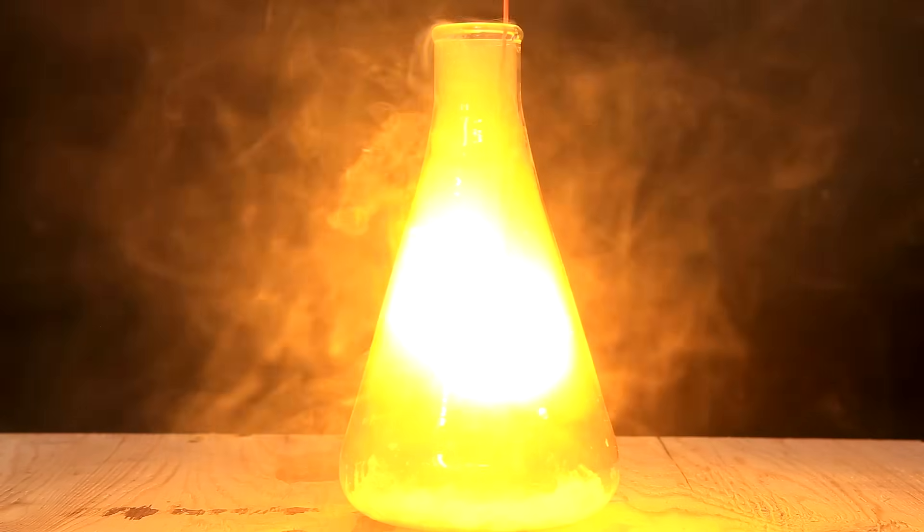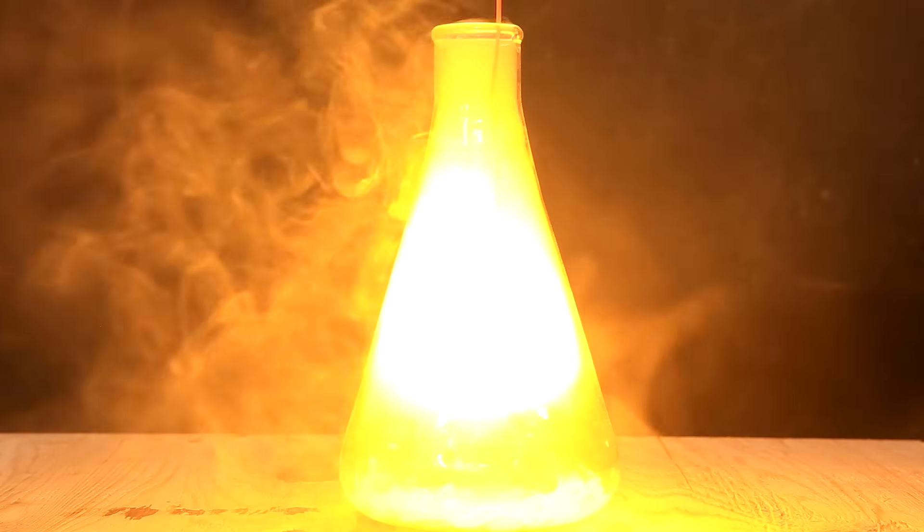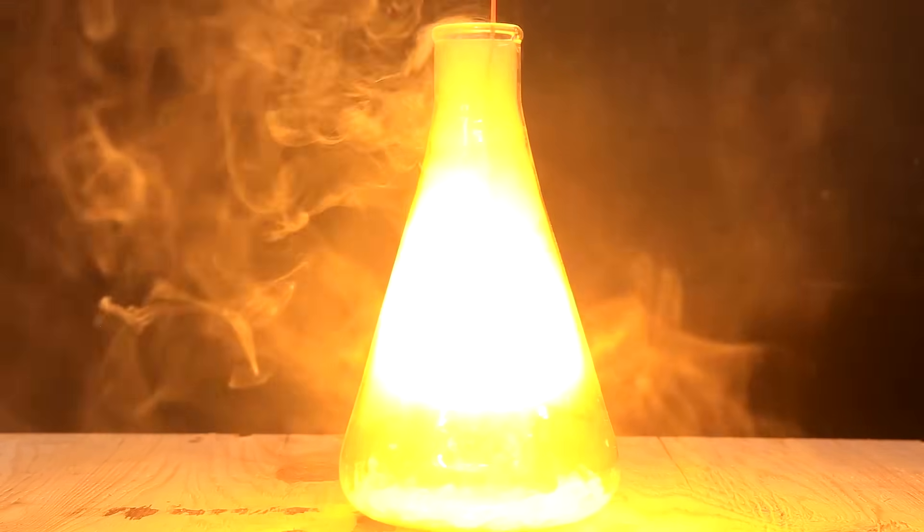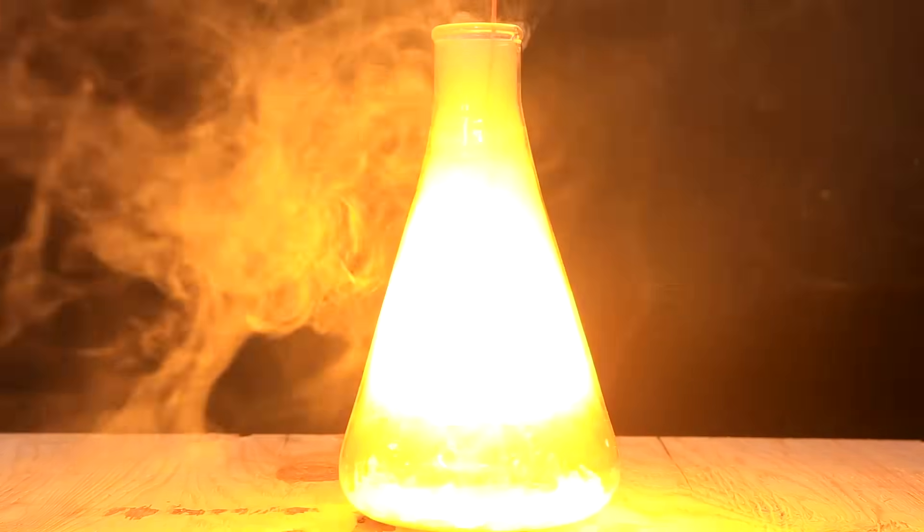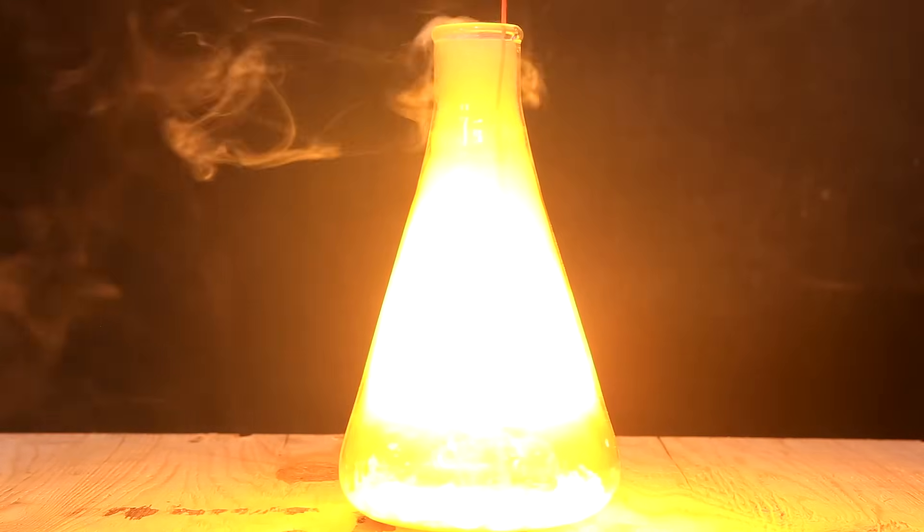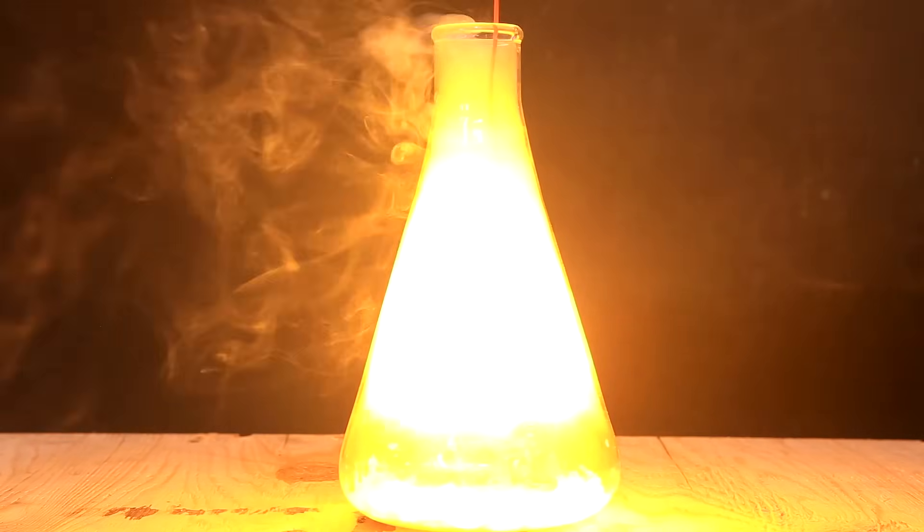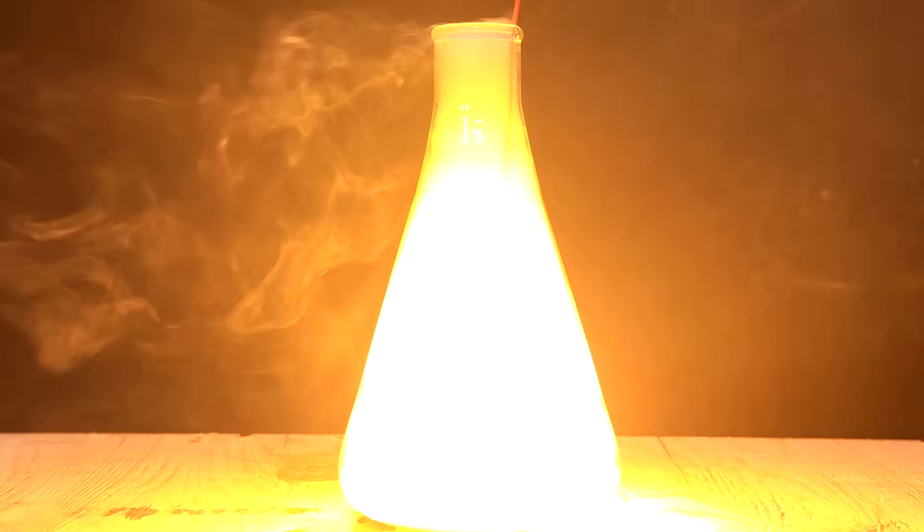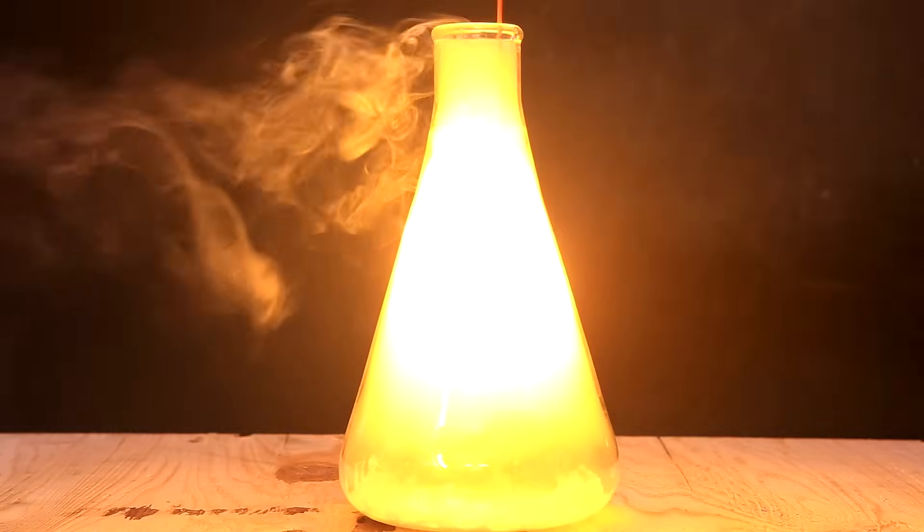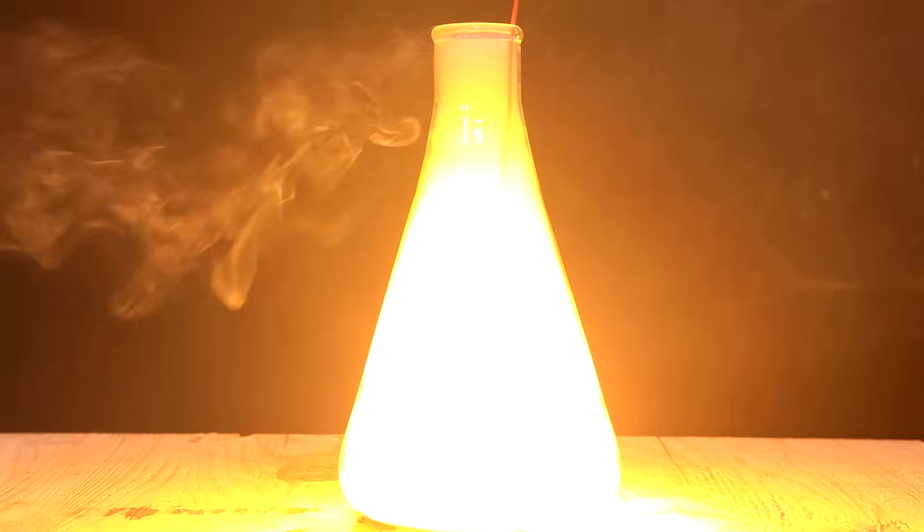The sodium burned really bright, and it turned my Erlenmeyer flask into a lantern. From demonstrations and other resources that I've seen online, I honestly expected this reaction to last no more than a few seconds. I'm not sure if I just used more sodium than the other demonstrations, but the reaction seemed to go very vigorously and bright for at least a minute.